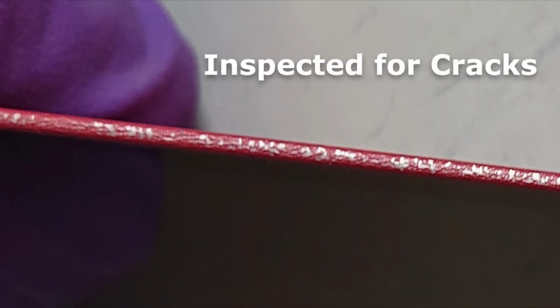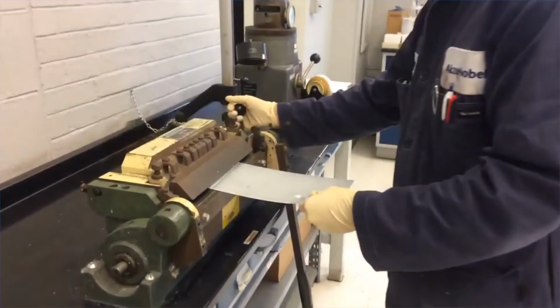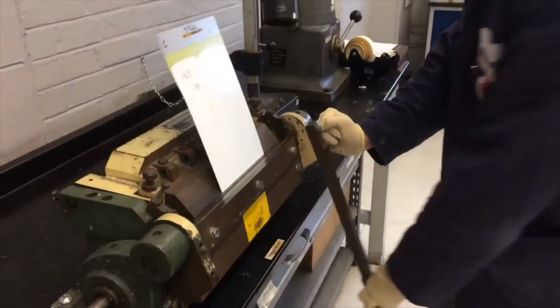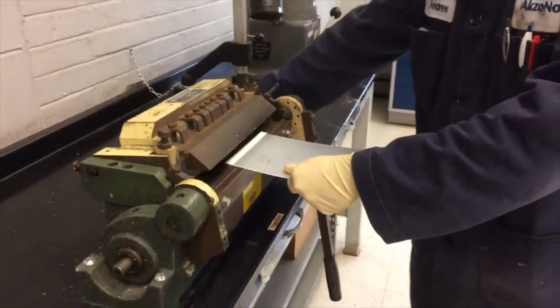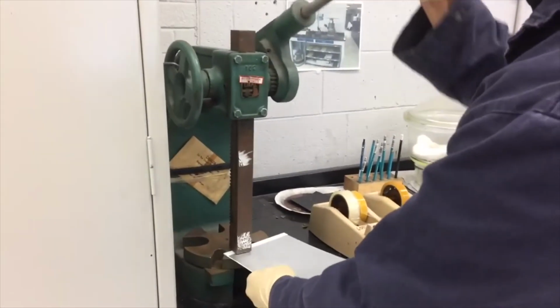Once a bend is made and crimped, it is common practice to inspect the bend for signs of cracking of the coating. Cracking may or may not be a significant factor in the long-term performance of the product. Where no cracking is important, it will be specified at a particular T-bend for those applications. There are several tools commonly used to perform the T-bend test. One technique is to use a bench-mounted bending brake. Once the metal is bent, it is imperative to crimp the metal tightly. This may be done in a vise or by using an arbor press.